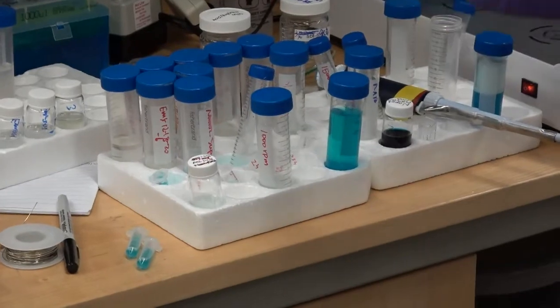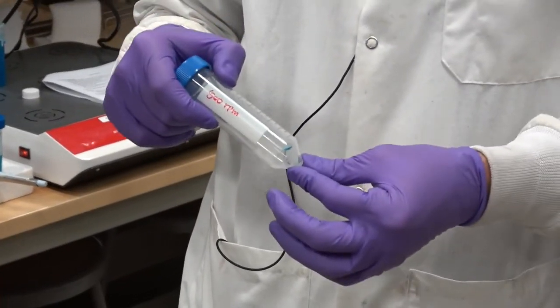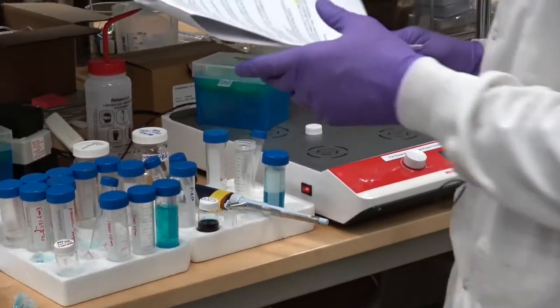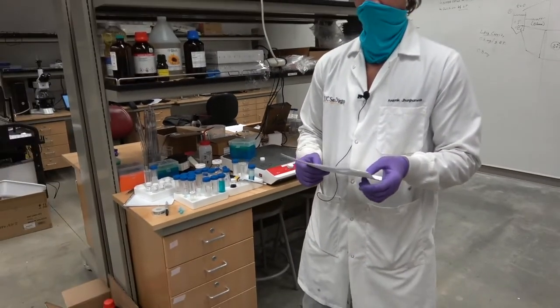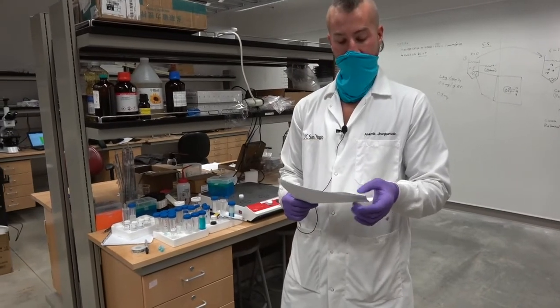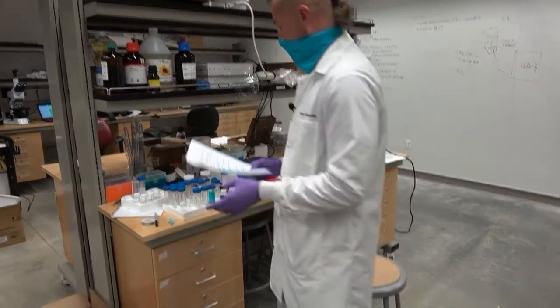Okay? So the next thing you would have done if you were here is we would have redissolved this and done DLS. The other thing that we would have done with some of those dissolved particles is lyophilization. And so that's section 4F. So let's pause here and go upstairs and I can show you the lyophilizer.